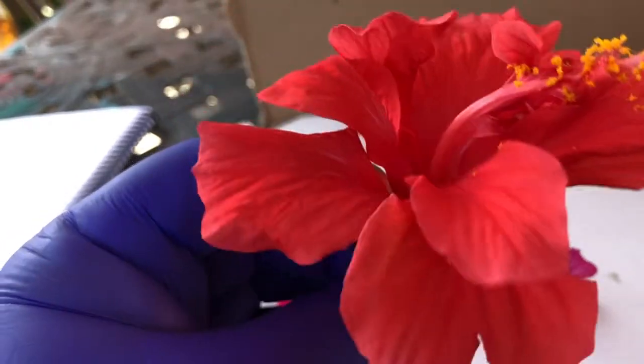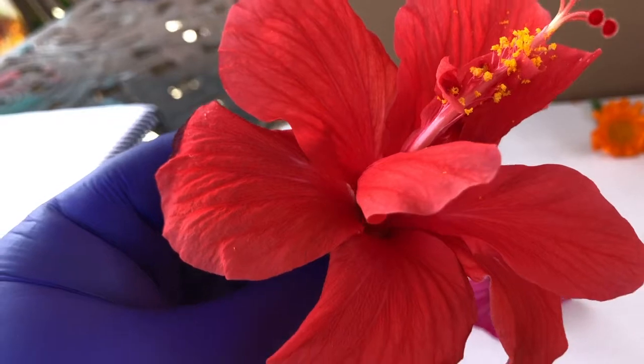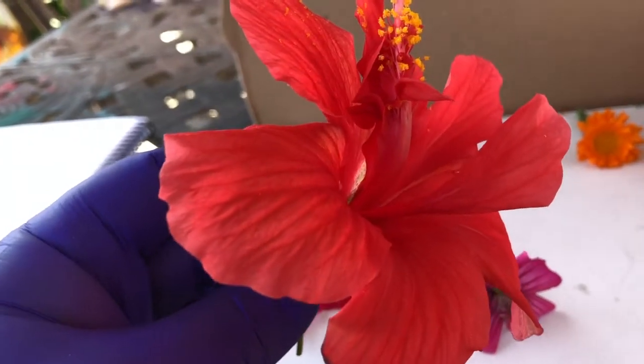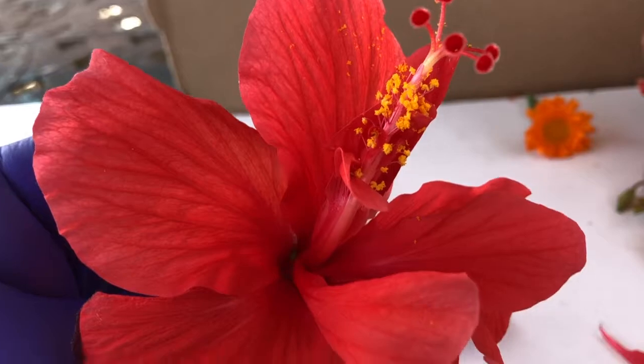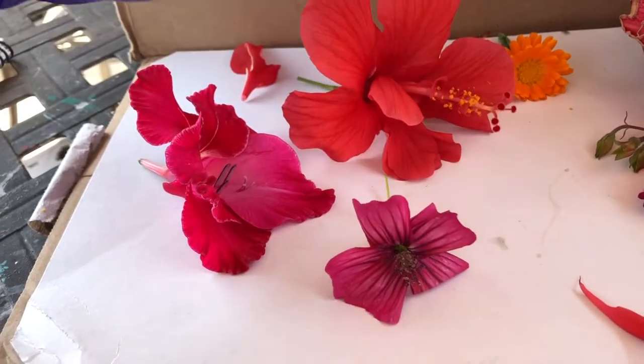And so while I'll be working with this flower here, I have already gone ahead and got us started on the dissection, just to save us a little bit of time so that you can have more time to do what you want to do out there with your family members in your yard. If you want to buy flowers or pick a flower, I borrowed these from my neighbor. She definitely did not mind.